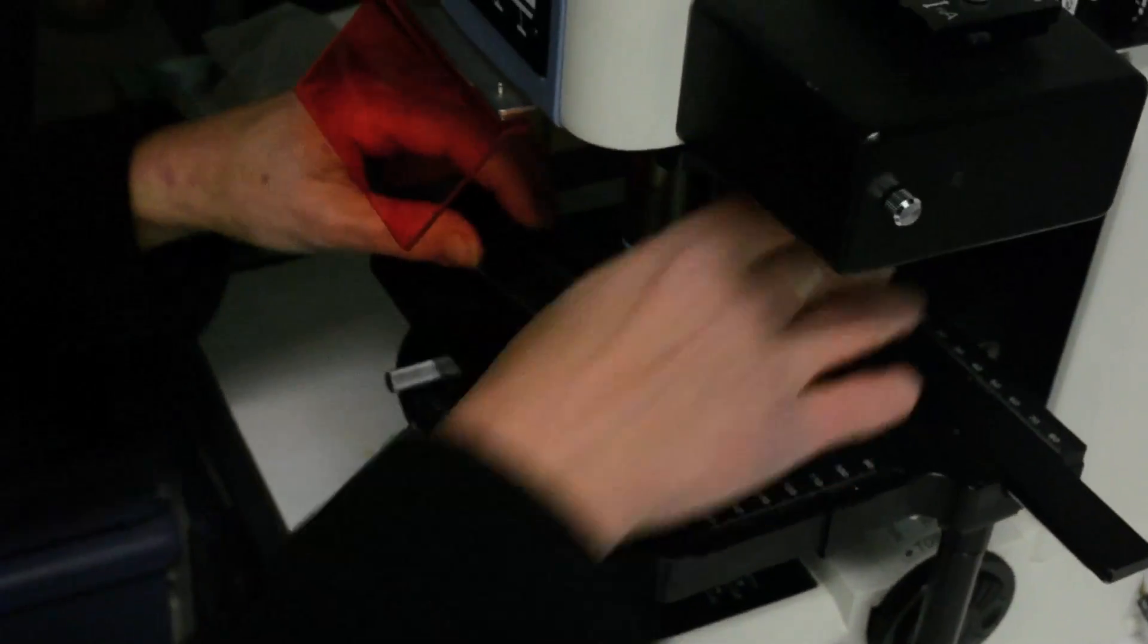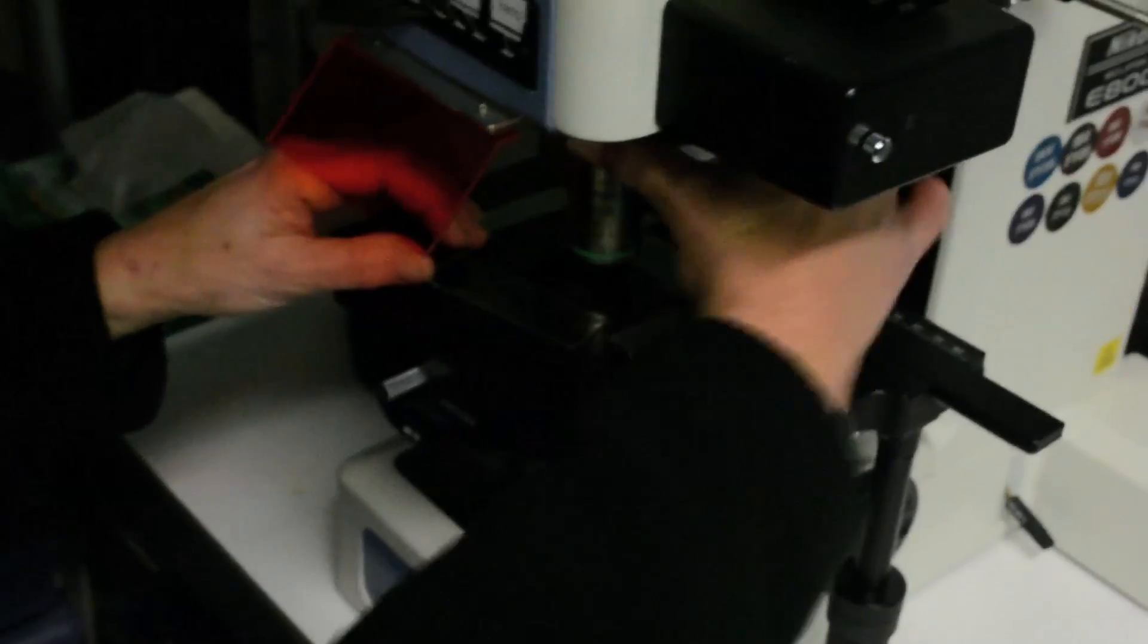If I put this on the microscope now, I can put this on a microscope slide, a few drops, and then add a cover slip. And now I can look at these under the microscope and I can see what is in the sample.